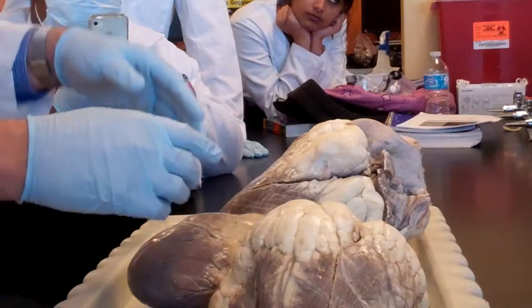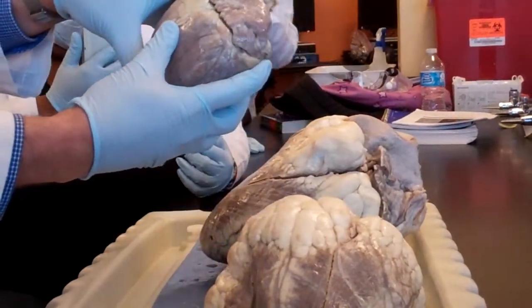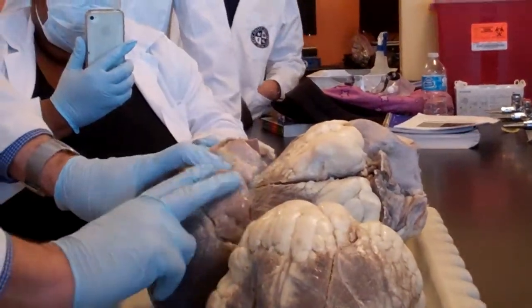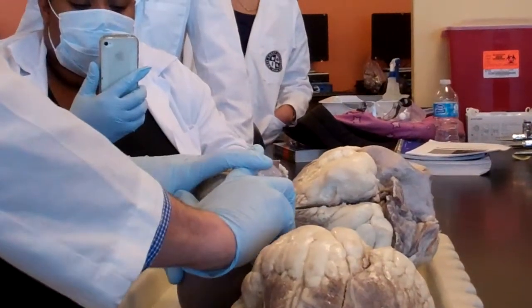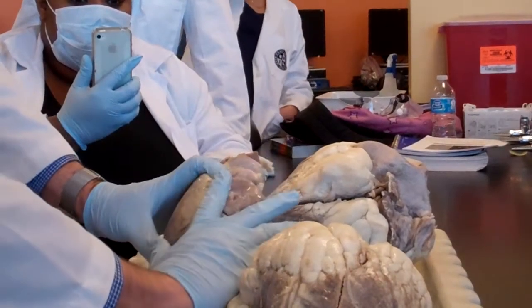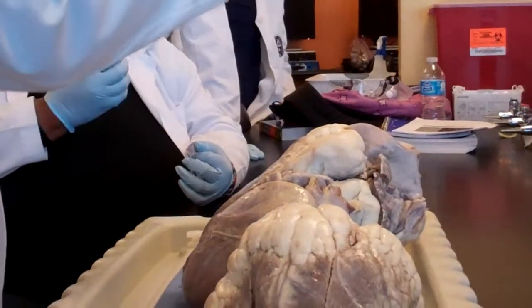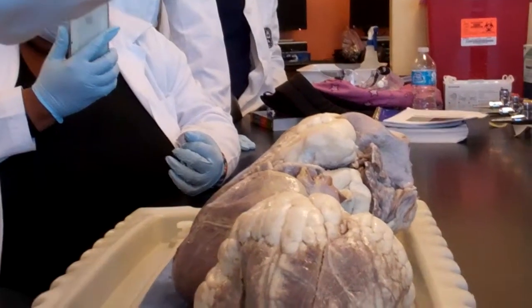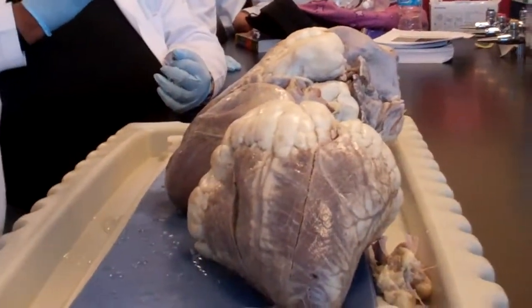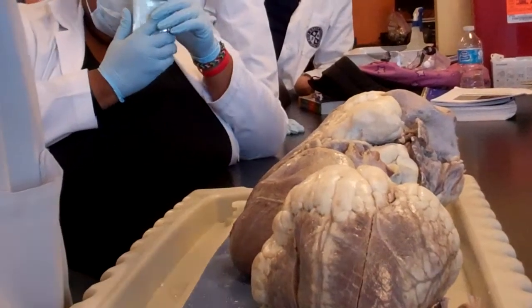Because the ventricle pushes the blood towards the left hand side or the left heart or the left side. And then the aorta has to make an X shape with it, because the aorta goes up from left to right, and this goes from right to left. So they technically crisscross each other, and you'll see that the aorta is coming from the left ventricle, pushing blood like this, and then making an arch of the aorta to go underneath or behind all the way. You're going to see this next week.